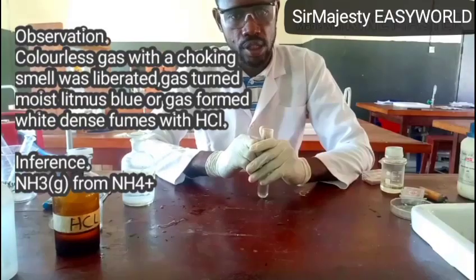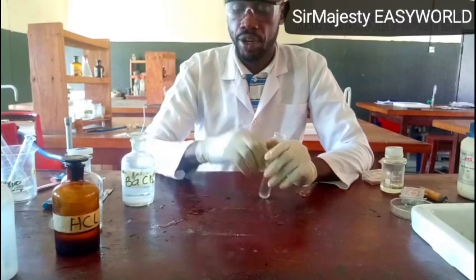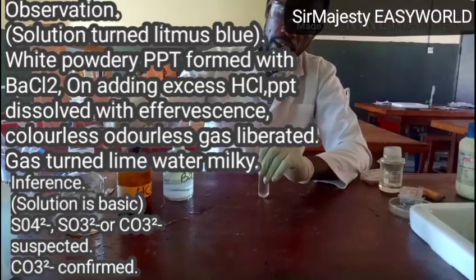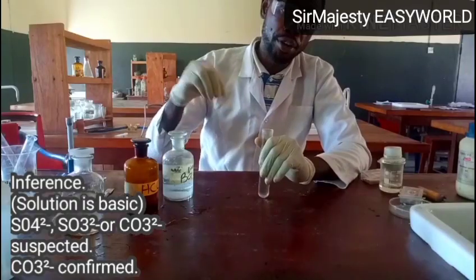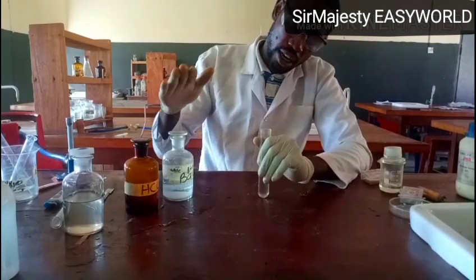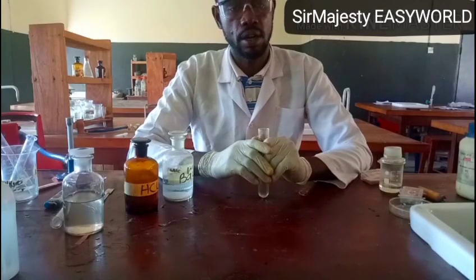Then another test that we did is to dissolve about half a spatula of C in 5 ml of distilled water, then add barium chloride followed by excess dilute HCl. This test can be replaced; there are two things that pair. If you use barium chloride, you use HCl, but I might decide to use barium nitrate. If I use barium nitrate, I will use excess HNO3. So the two pairs that can work are either barium chloride and HCl, or barium nitrate and HNO3. All of them show similar results.